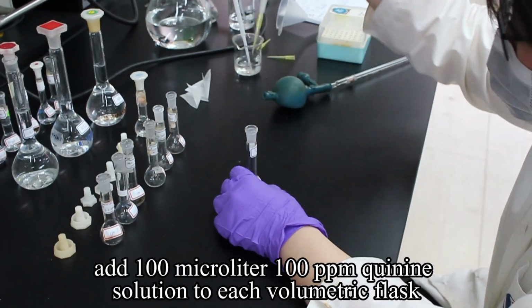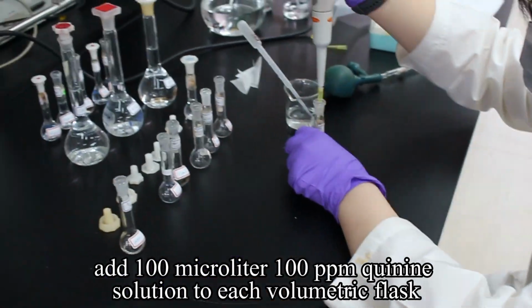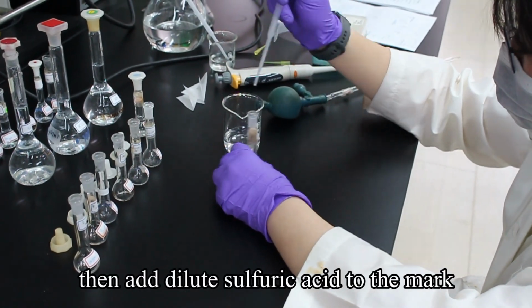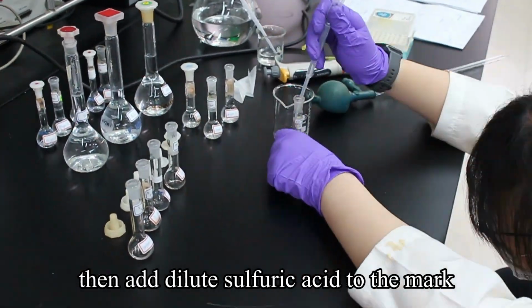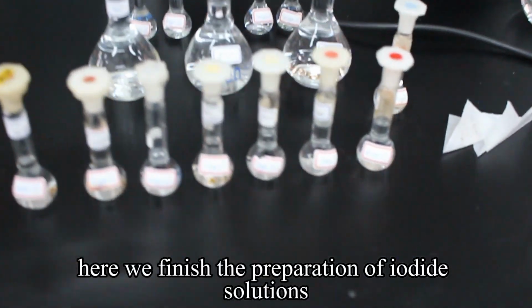Add 100 microliters of 100 ppm quinine solution to each volumetric flask. Then add dilute sulfuric acid to the mark. Here we finish the preparation of iodide solutions.